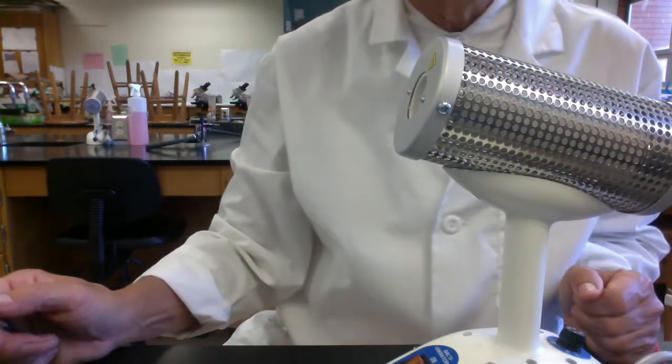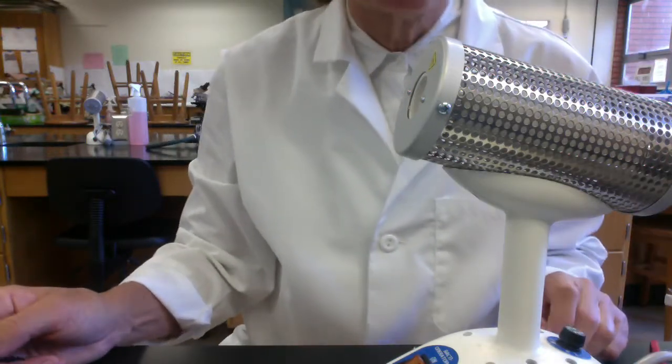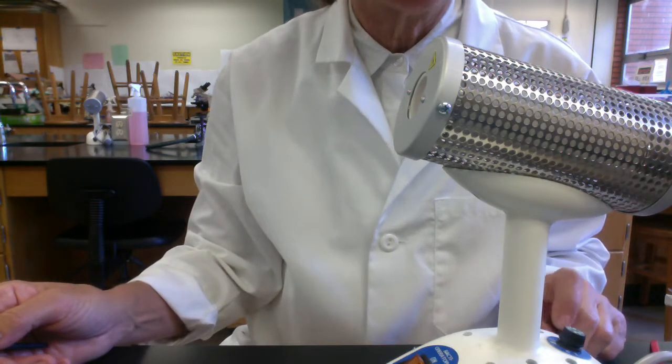Micro folks, the headless microbiologist returns. This short video is to show you how to properly use the Bacti incinerator.